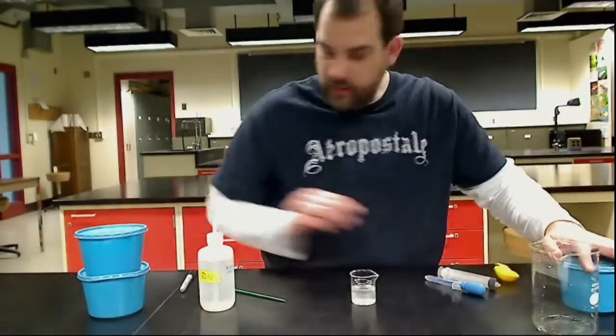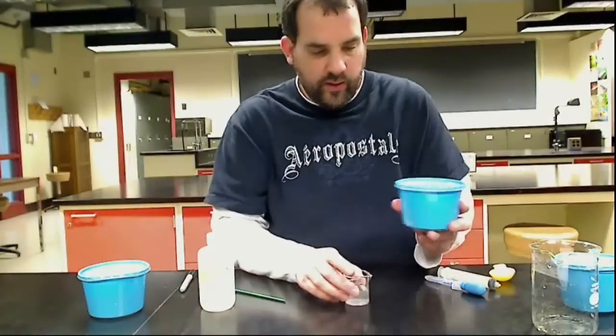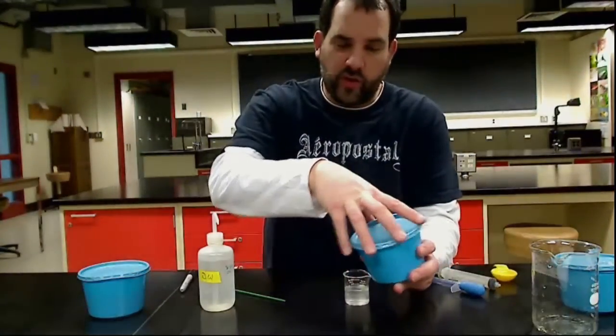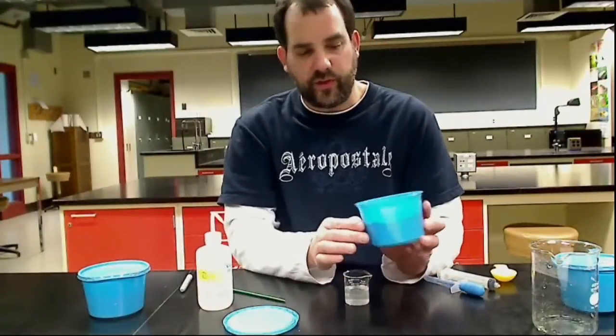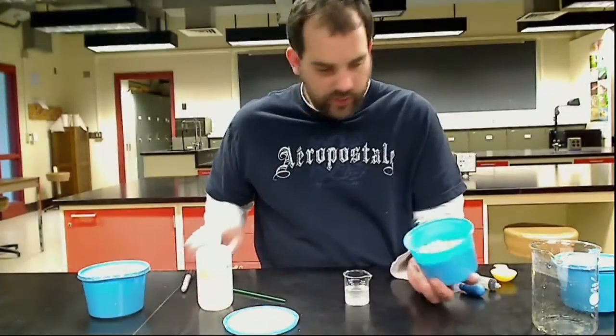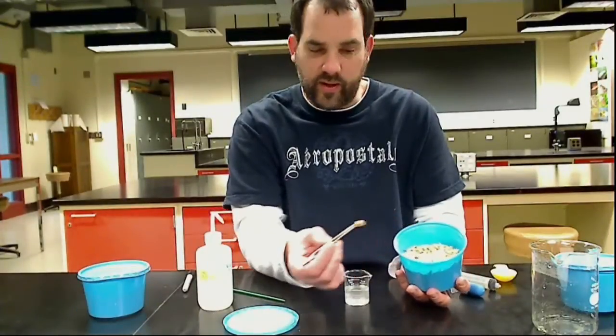You have ordered your other cups that you're going to actually use for your field inoculation. So these are the field cups, and these are your live galleria. You can kind of see them squiggling around in there.